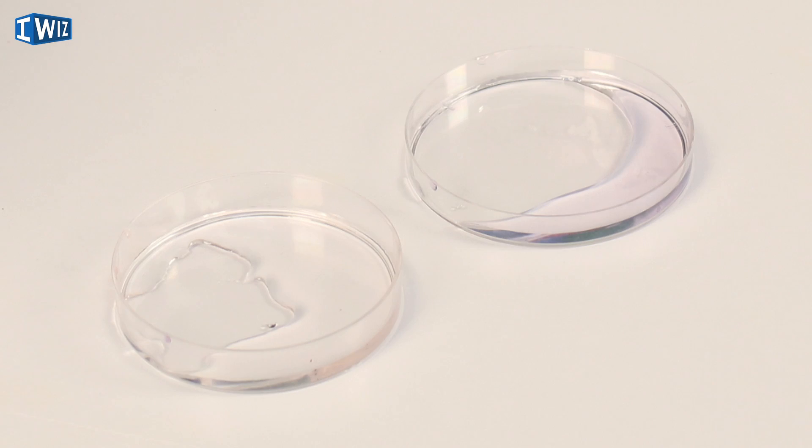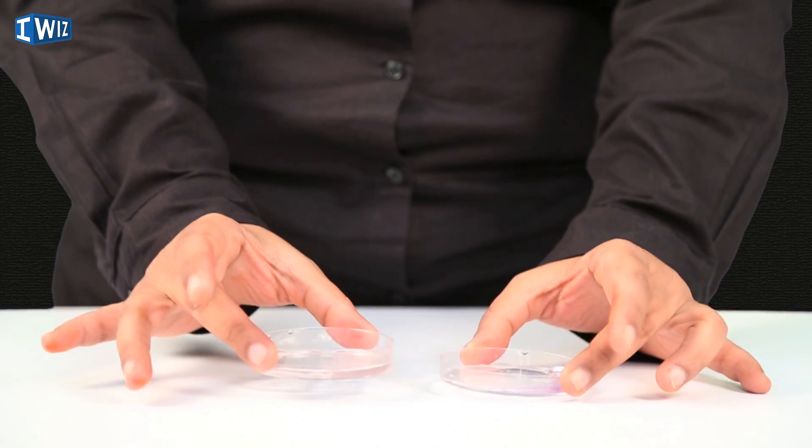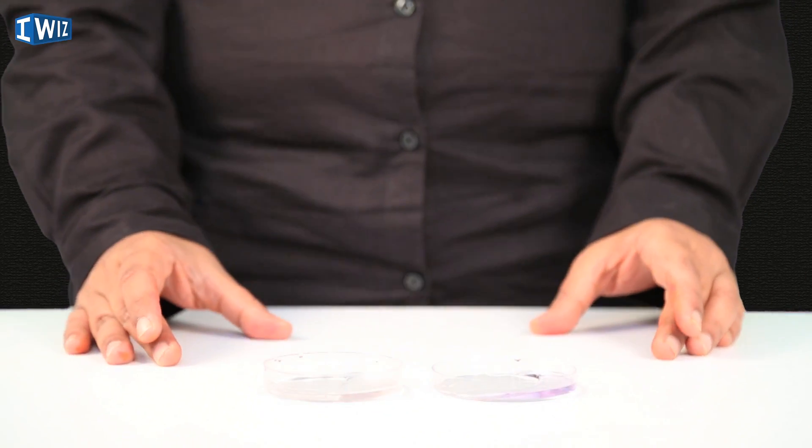I have two chemicals over here — one of them is an acid and one of them is a base. Can you tell me which one is which? It becomes extremely difficult to know just by looking at them, and it's not always safe to taste or smell chemicals. So scientists came up with a way — they observed that certain chemicals in nature had a color, and upon the action of an acid or base, they changed their color. This could indicate whether a solution was an acid or a base, which is why these chemicals are known as indicators.